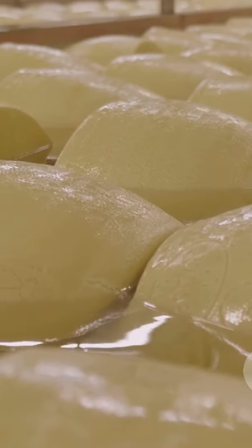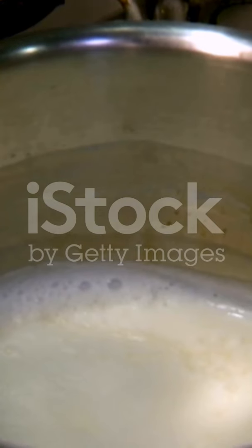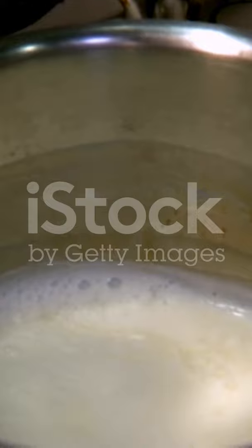A clean break test can be done by inserting a clean finger or knife at an angle. If the split is clean, coagulation is complete. Heat and acid combination coagulation.